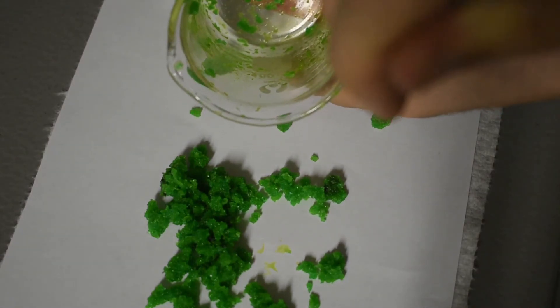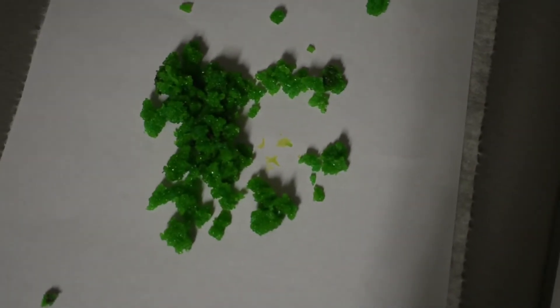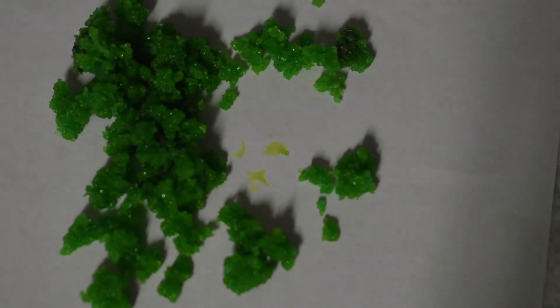So that's what it looks like, very nice green. I'll clean up that beaker off camera but I want to give you a nice look at these crystals. Really nice green.